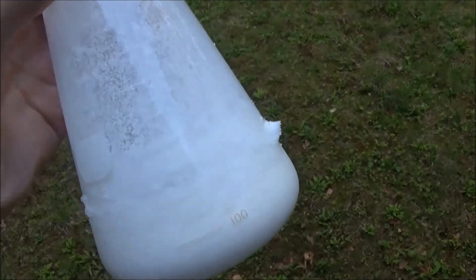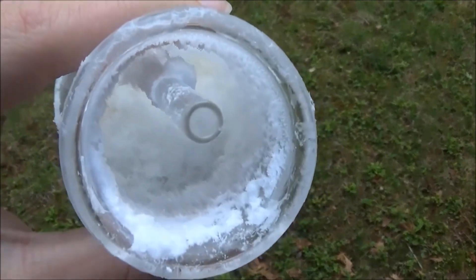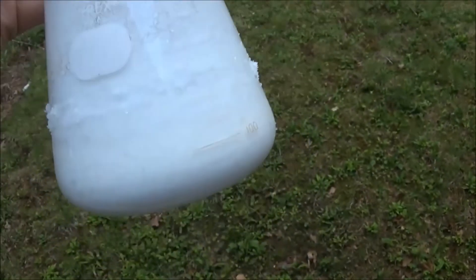The reaction was rather uneventful, but eventually, it finished, and I took it off and let it cool. It gave the solid you see here.